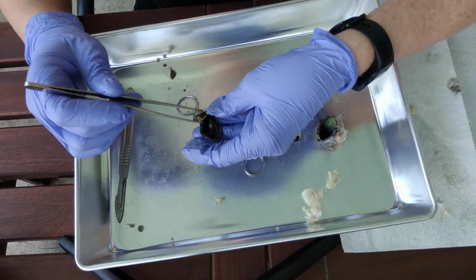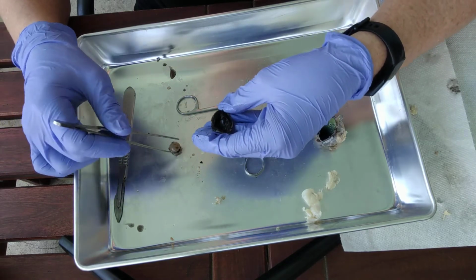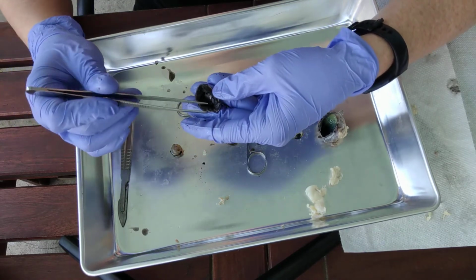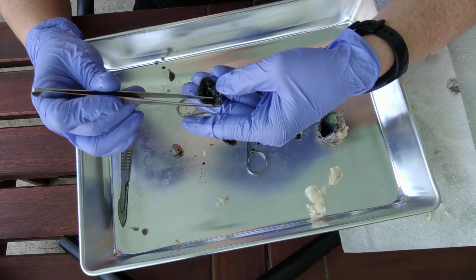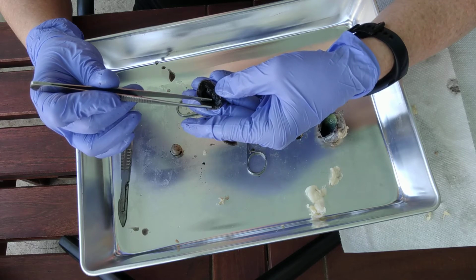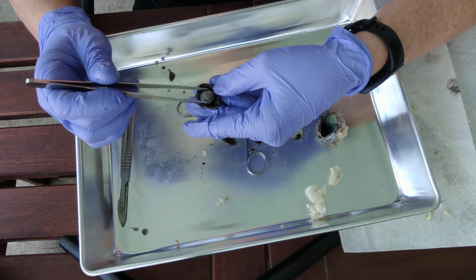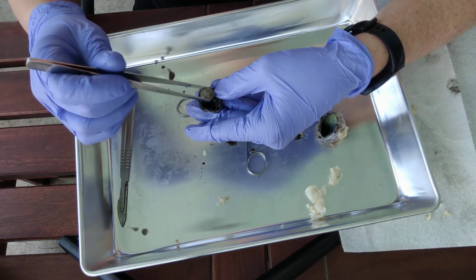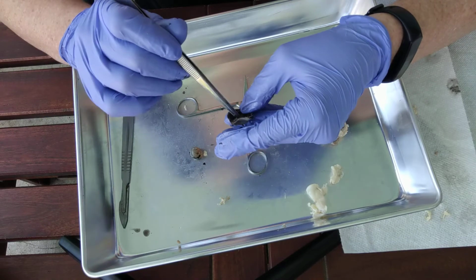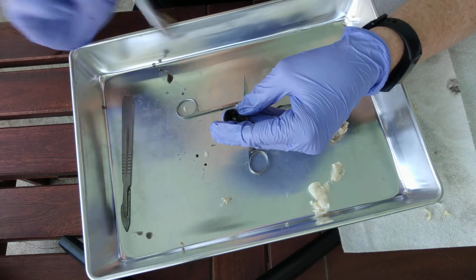So usually in real life that lens would sit right here and it will be attached to the eyeball, kind of floating, suspended to the ciliary body. If you look carefully at the texture on your ciliary body, you'll see something that looks like the underside of a mushroom. That is going to be the ciliary body, and that is where the ciliary zonules, which are the little suspensory ligaments that hold and connect to the lens, sit. And again, it'll just sort of suspend it like that, so that as the light goes through the cornea, through the pupil, it'll hit the lens behind it.